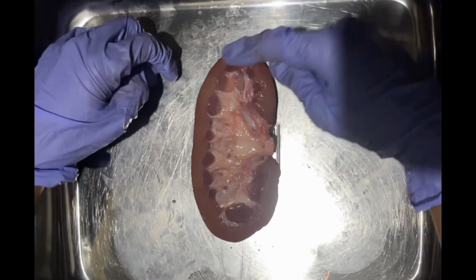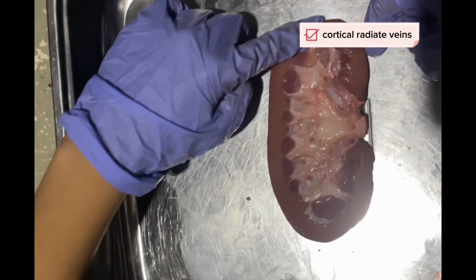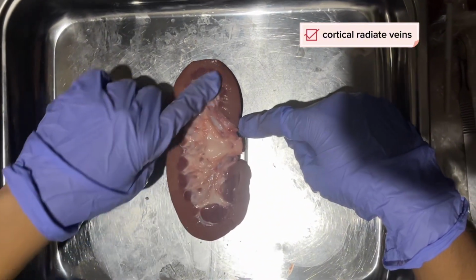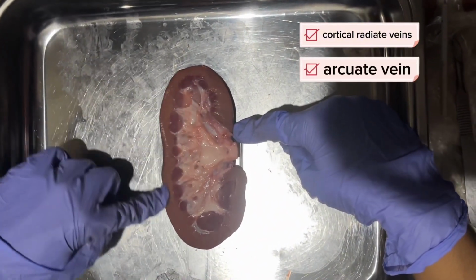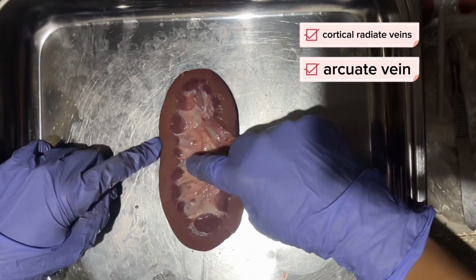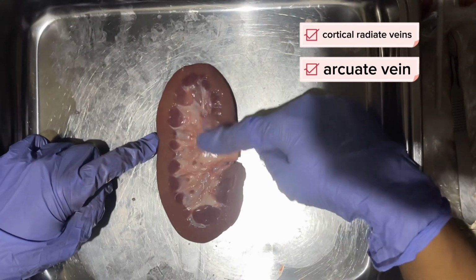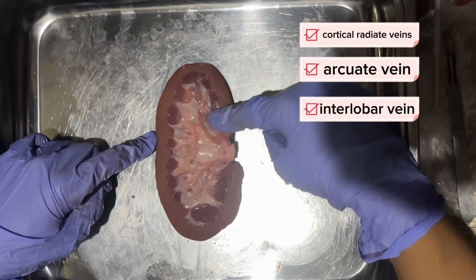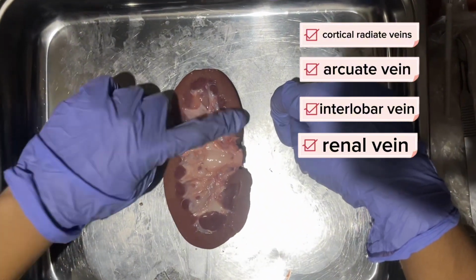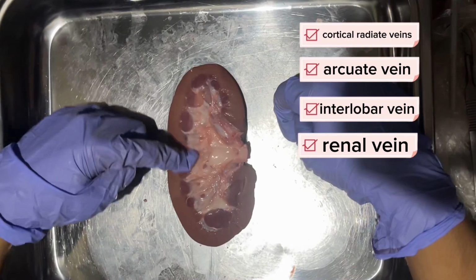And lastly, it will converge again in the cortical radiate veins or the interlobular veins. Then, it will pass through the arcuate veins at the base of the pyramids. This leads the blood back to the renal columns and the interlobar veins, which then go to the renal veins in the hilum region, before sending the filtered blood to the inferior vena cava and the heart.